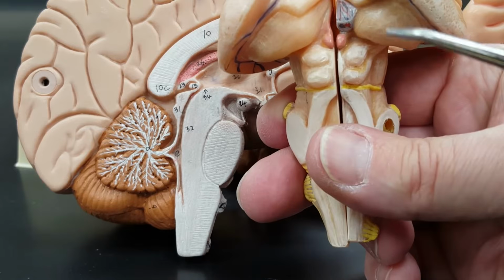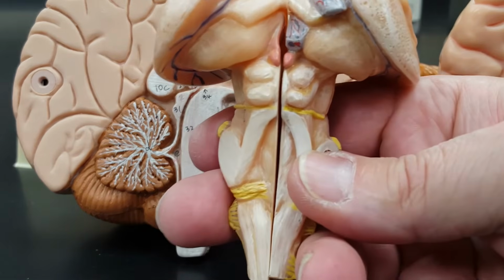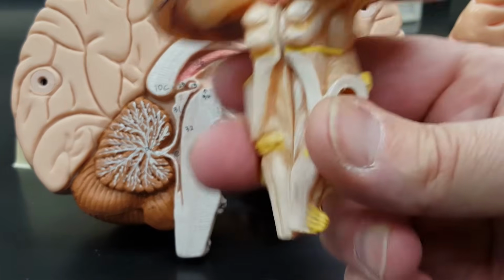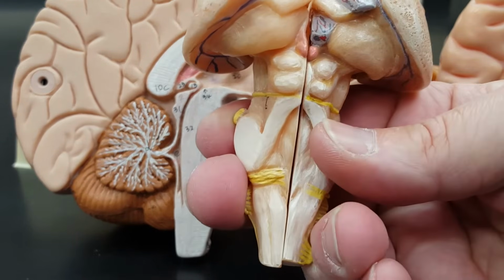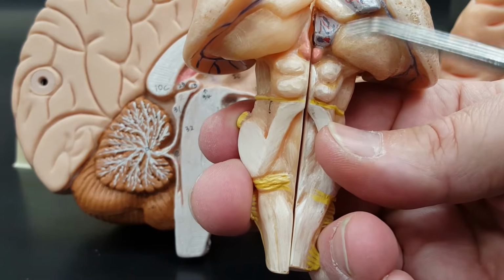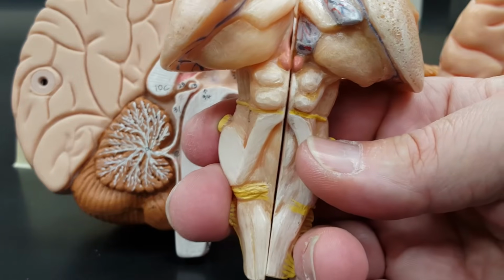This is the posterior side, the back side of the midbrain. I can see the 4 bodies best when I look at a brain stem from behind. Pay attention in your lecture to what the function of these things are. They have to do with some of our reflexes that take place in our head. Some of you will actually be testing those on people.